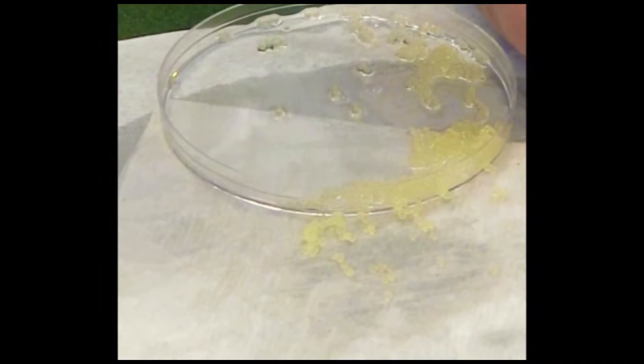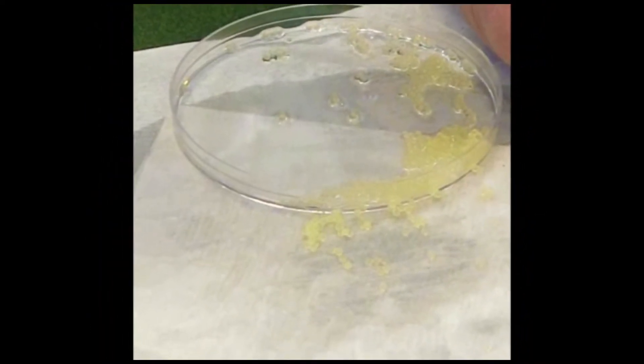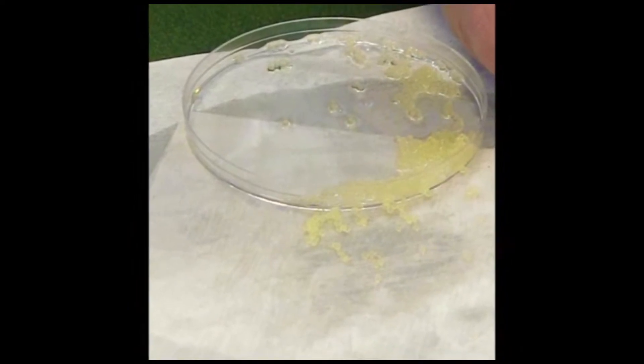Remove a small amount of eggs, about a tablespoon, from the bell jar and place in a petri dish. Eggs should be separated from excess water using paper towel or an eyedropper.